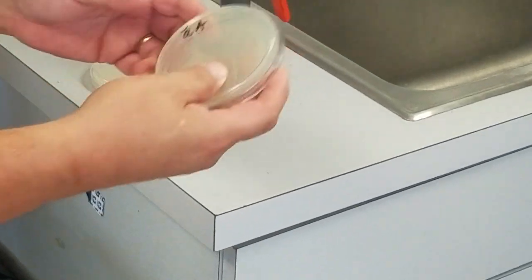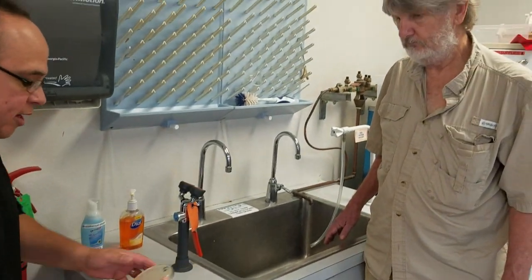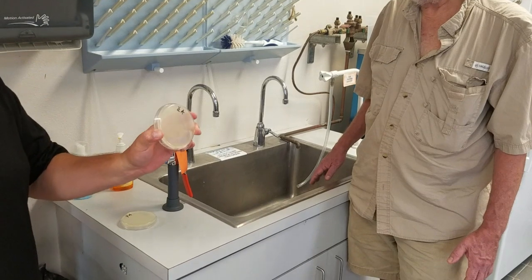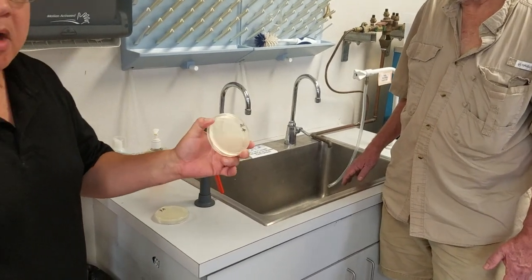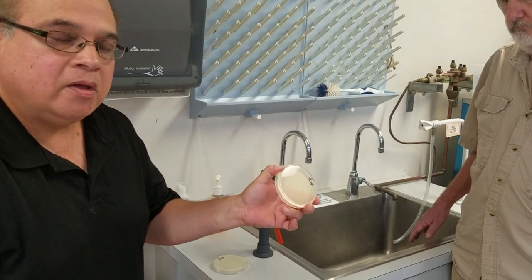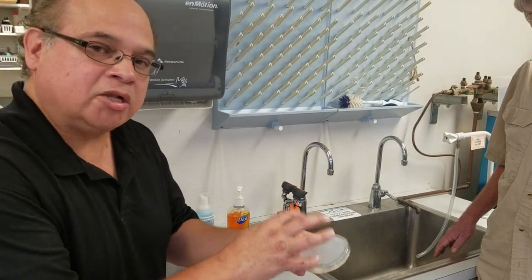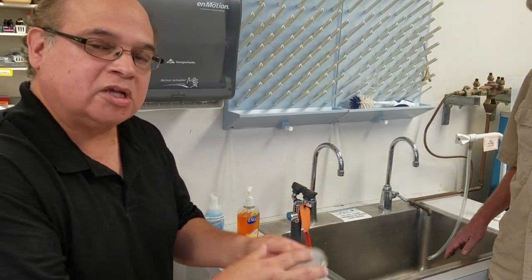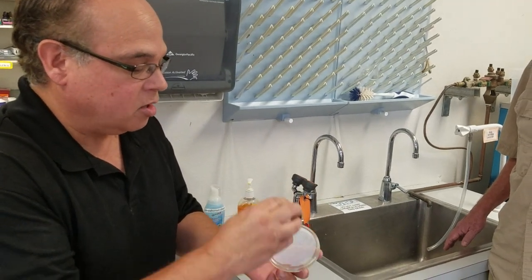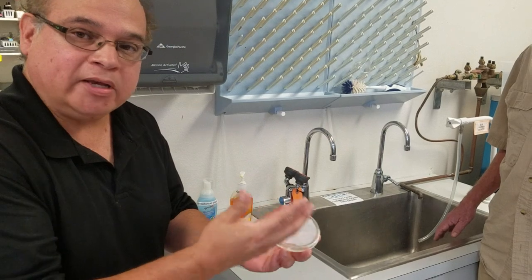This is Dr. John, and I'm going to open up this plate. This is nutrient agar — it's a recovery medium. It will pick up any organisms that are on our body, so if we just touch these plates, whatever is on our body will be put on this plate and it'll just grow.